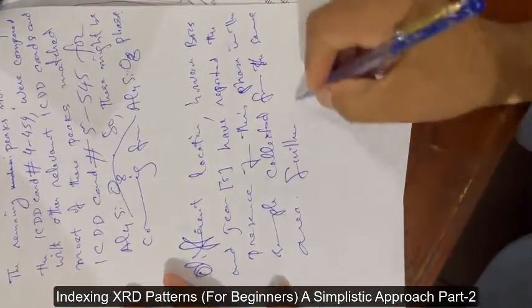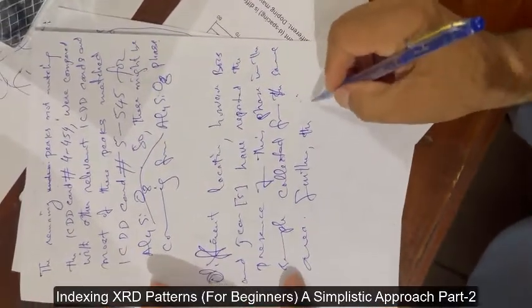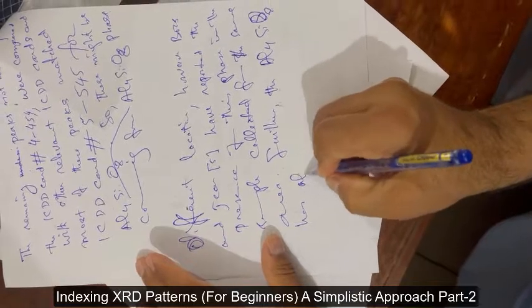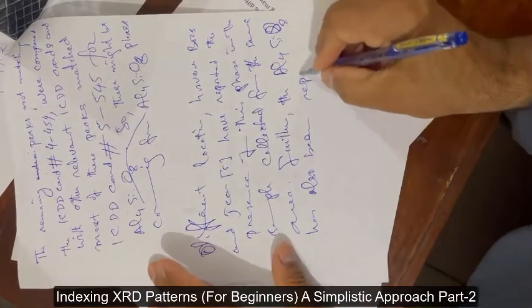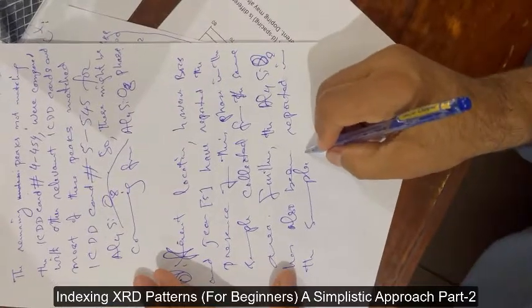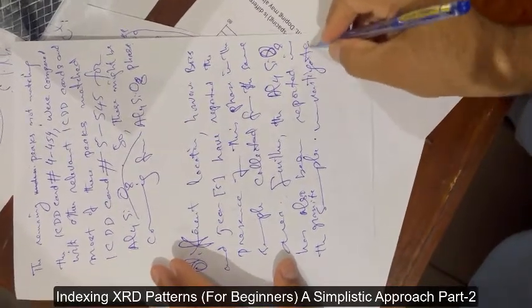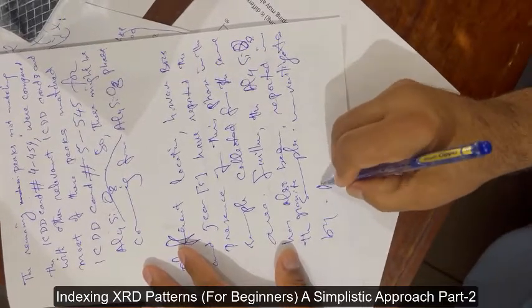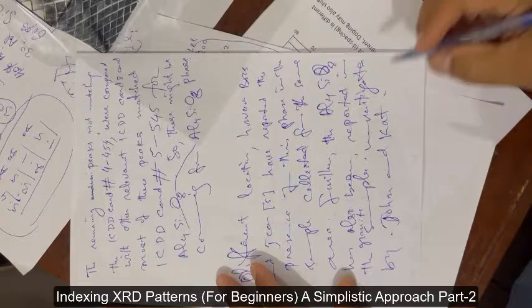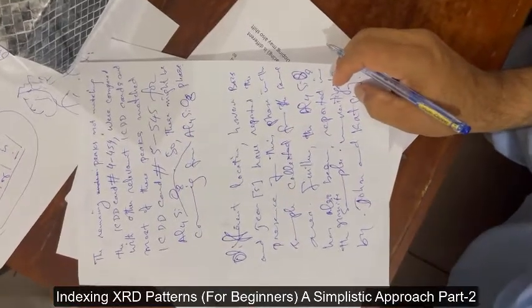Furthermore, the presence of the next phase Al₄SiO₈ has also been reported in the granite samples investigated by John and colleagues — then you give the reference number. This is the proper way to characterize XRD spectra: take the plot, find d-values and relevant intensities, match them with ICDD cards, and when they are consistent with previous studies, label the hkl indices on the peaks.